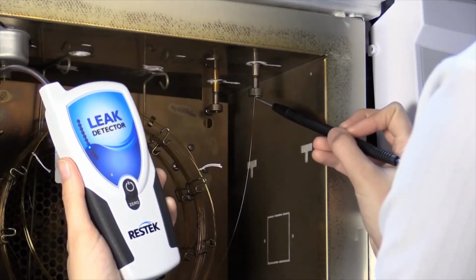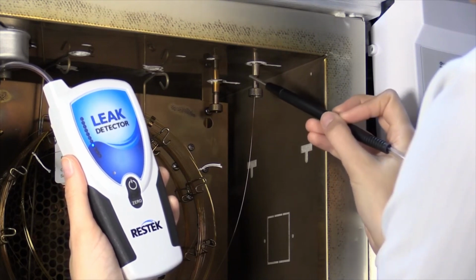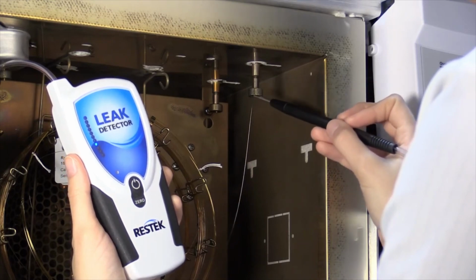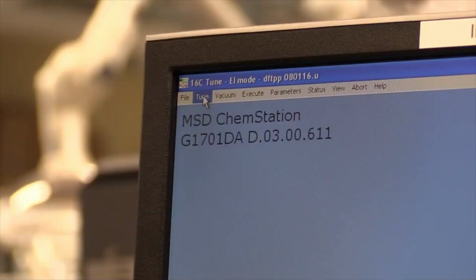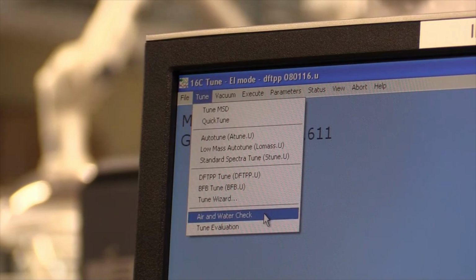Detector nuts from atmospheric pressure detectors such as FIDs and TCDs can also leak if improperly tightened or if a column breaks during installation. We do not recommend the use of a leak detector to check MSD nuts because the vacuum draws in any leaking gases and prevents detection of a leak. Performing an air-water check using your mass spectrometer will indicate if there is a leak in your system.